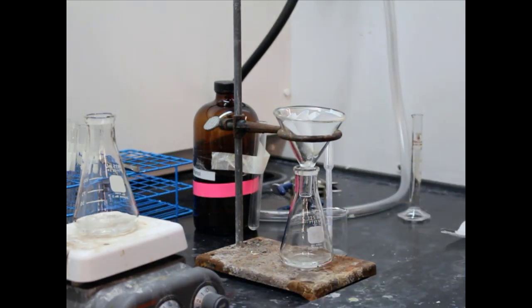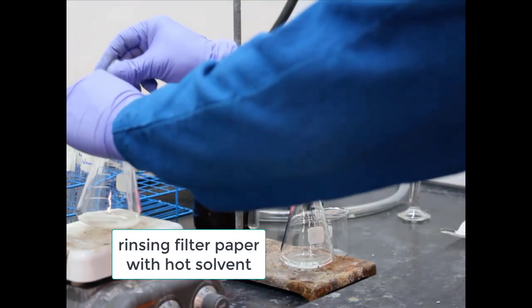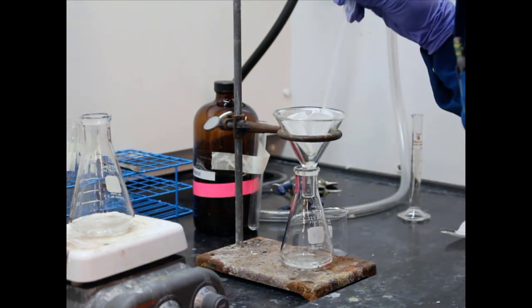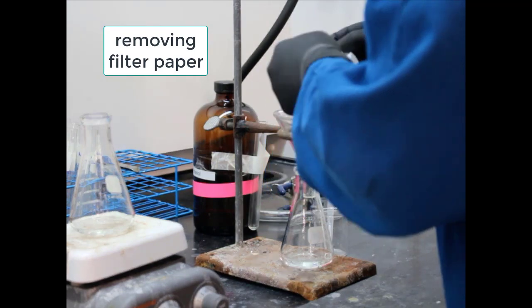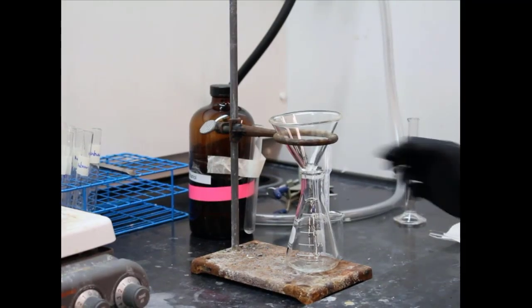All right, now this filter paper has our impurities in it. So this can be discarded, thrown away in solid waste, in a Ziploc bag. Okay, we can see it's slowly not dripping. And they're kind of showing you the impurities.